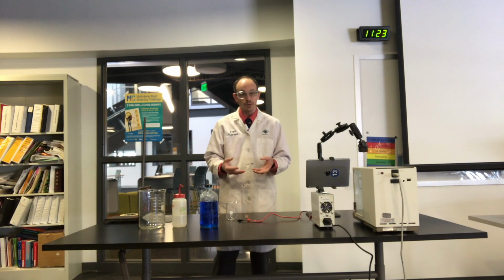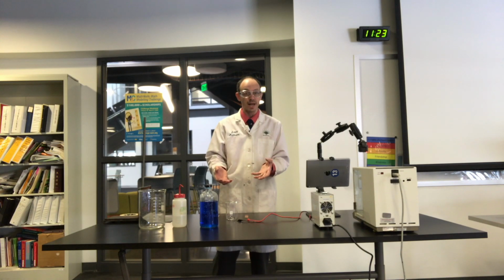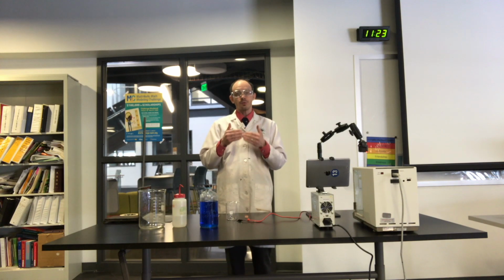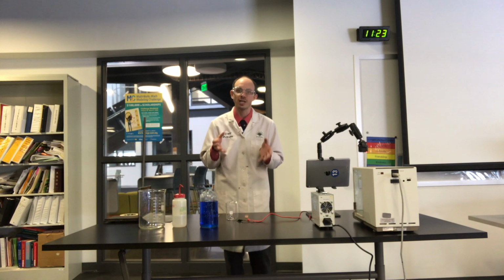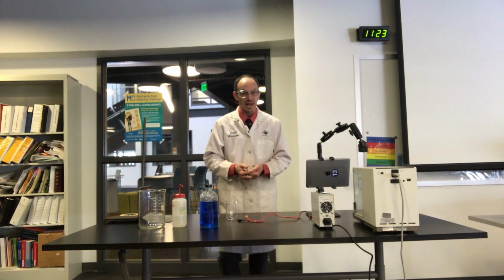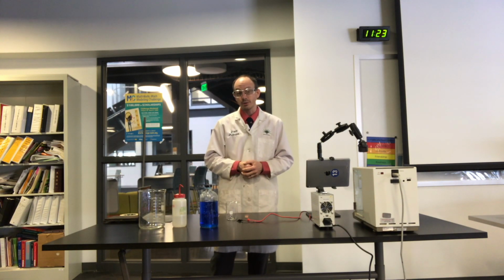So there's a lot of stuff that we can tell by being able to monitor amperage and time inside of a reaction. So as you are taking data today, I urge you to find the midpoints of all the amperage data, because it's not going to stay 100% consistent the whole way through. But what you need to do is trace the amperage and keep track of it as well as you can, so that you can, as accurately as possible, talk about the amount of coulombs of charge that have transferred, so that eventually you can come up with Avogadro's number.